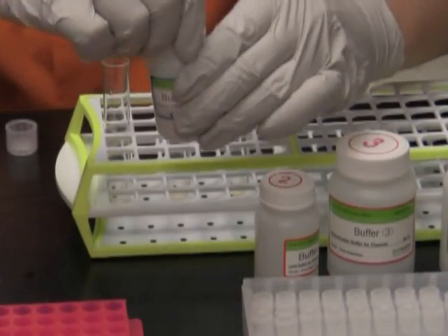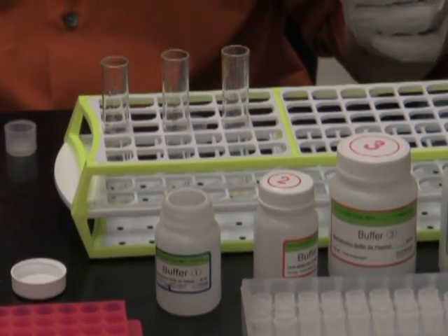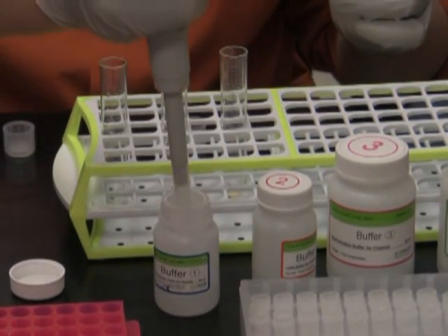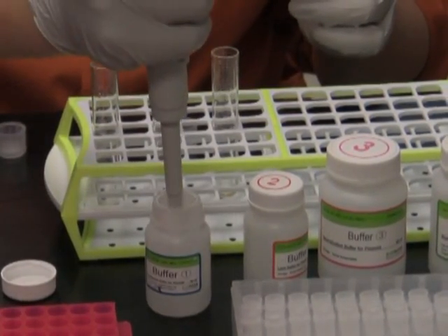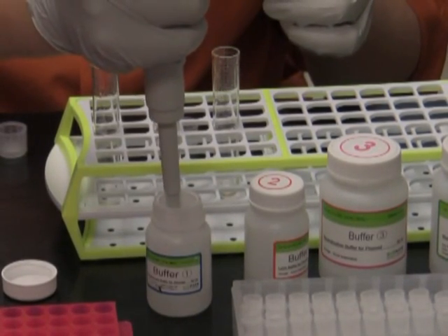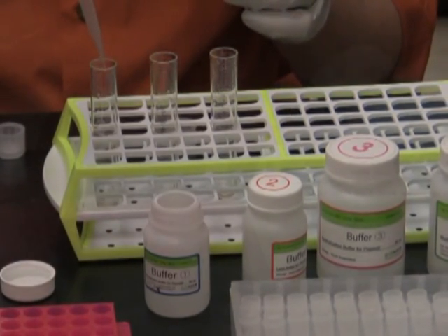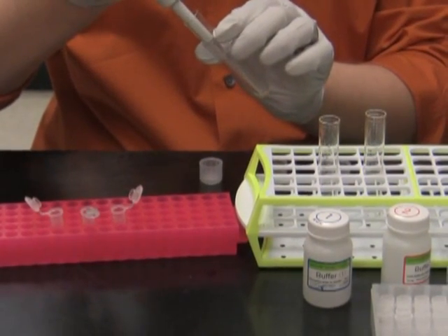Then I add 250 microliters of resuspension buffer. Then I resuspend the pelleted cells and transfer them to fresh Eppendorf tubes.